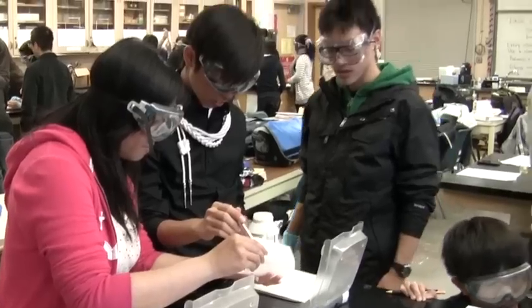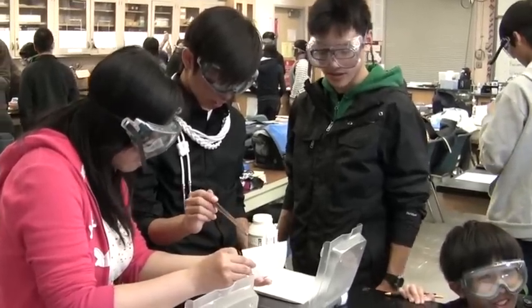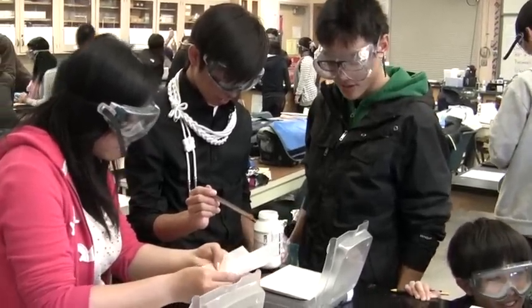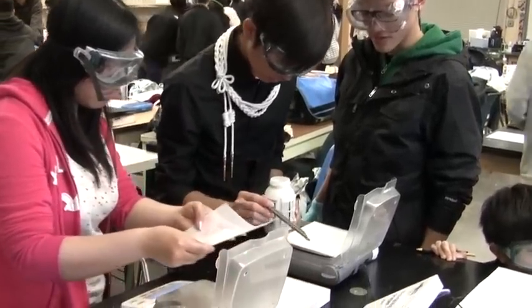My name is Jonathan Yoon and I'm a junior. I thought it was pretty interesting because compared to previous labs it was a lot more precise in terms of the pipette usage.